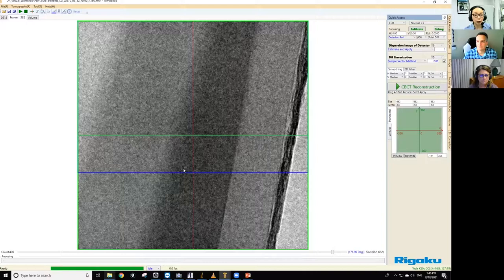But when I say that, we're assuming that the thickness of the sample is the same, because in projections, even if the sample density is the same, if one part is thicker, that part is going to absorb more X-rays. So to really see the density difference, we do have to reconstruct the results. So let me run that.